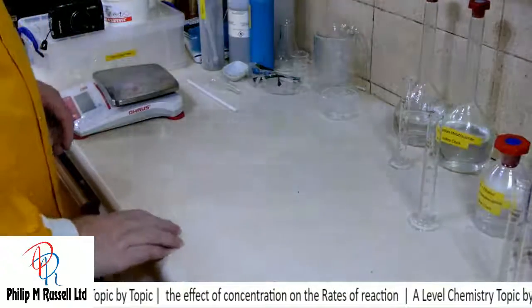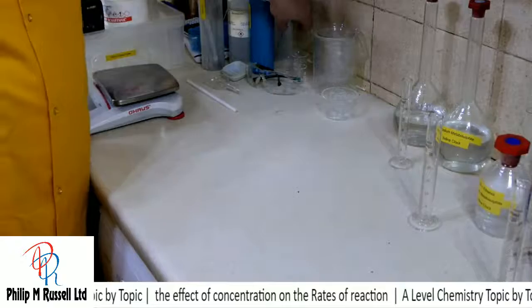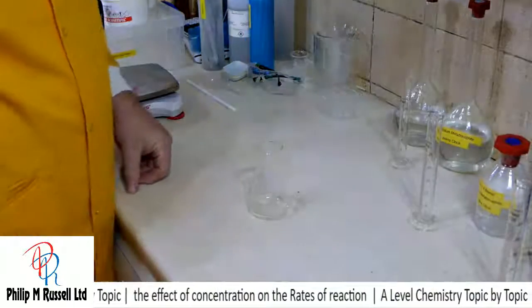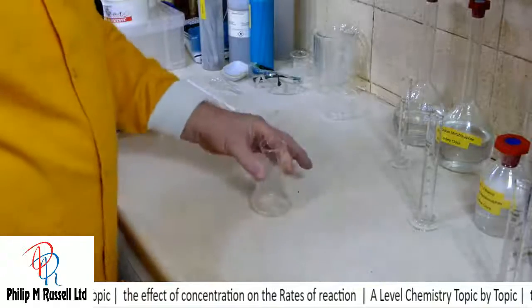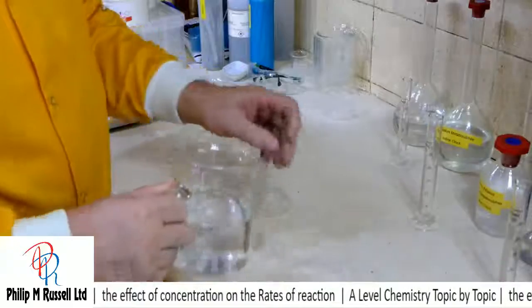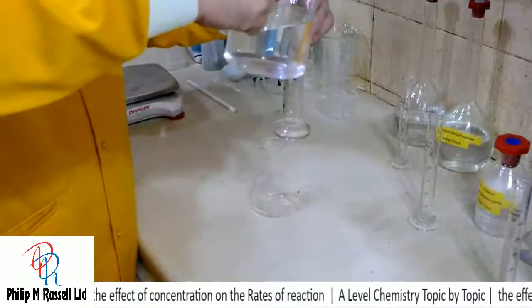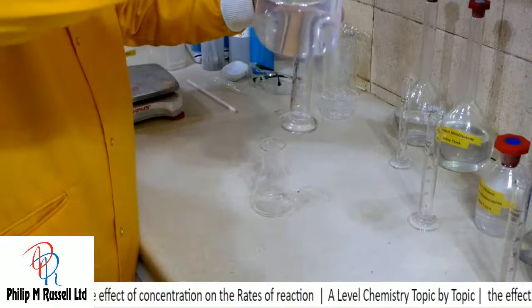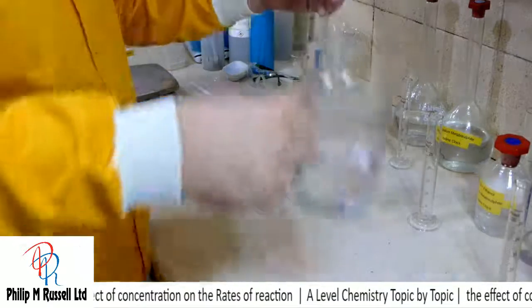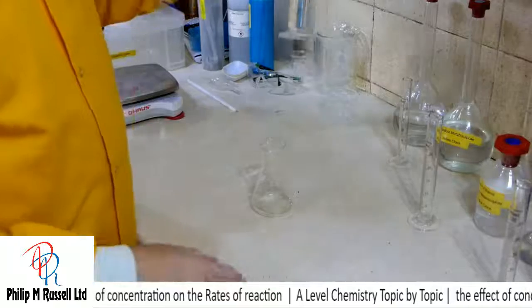If you've never seen this reaction before, then it's worth having a quick look and seeing what it does. So let's take a simple conical flask, and I'm just going to put some distilled water in here. I'm not going to be very accurate.